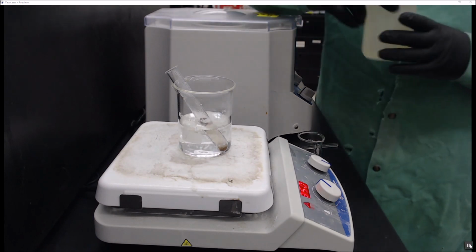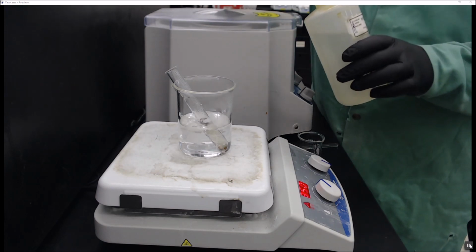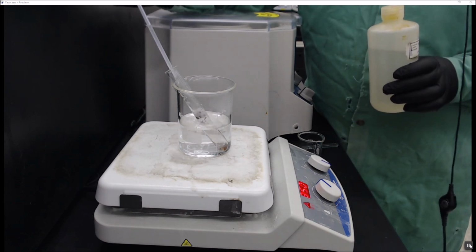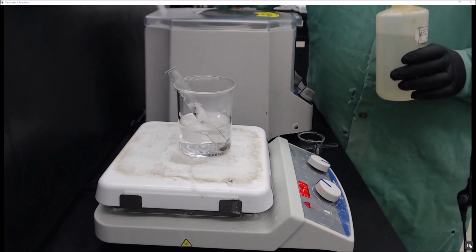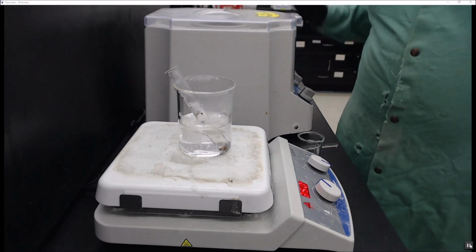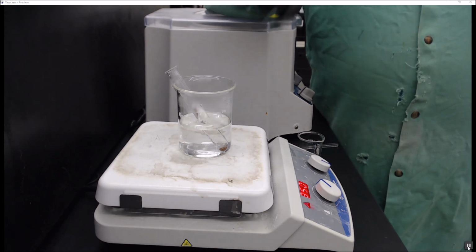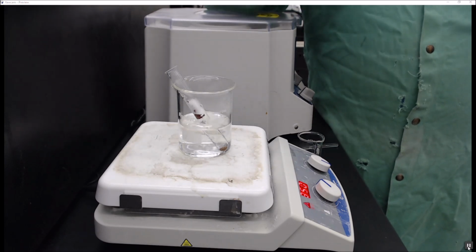Alright, it is now 2 minutes later. I know this might be a little disorienting for you watching on YouTube. So now we're going to get rid of the rest of our magnesium. The foaming has decreased in intensity, and I'm adding this very slowly. You can see the foam is rising and frothing, and so we want to be very careful. You do not want this to overflow onto the hot plate. That would be not optimal. As it is, we're going to get rid of this magnesium. This will cook for another 2 minutes to make sure we get rid of all the extra metal, and we will just have some nice copper and soluble compounds in solution.